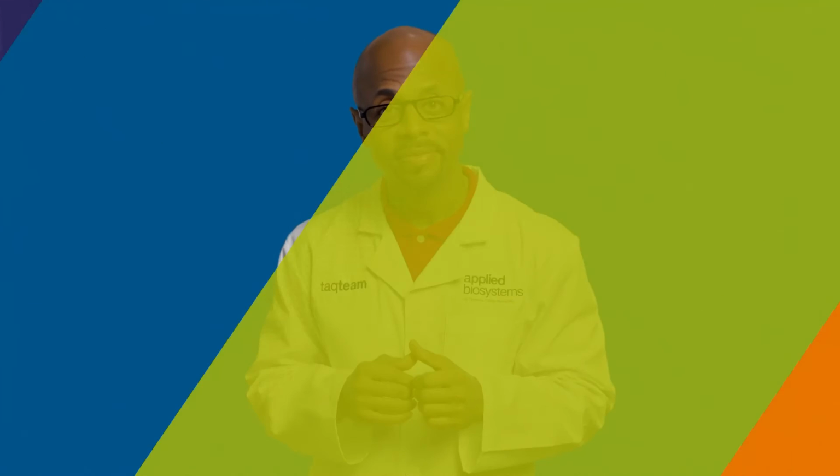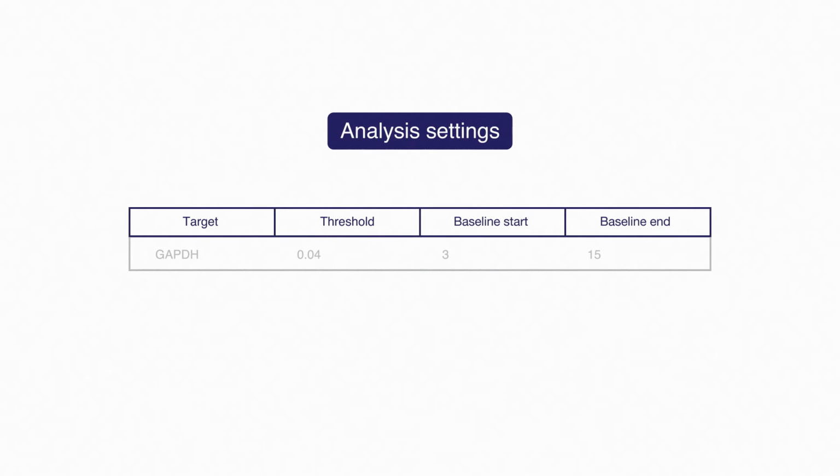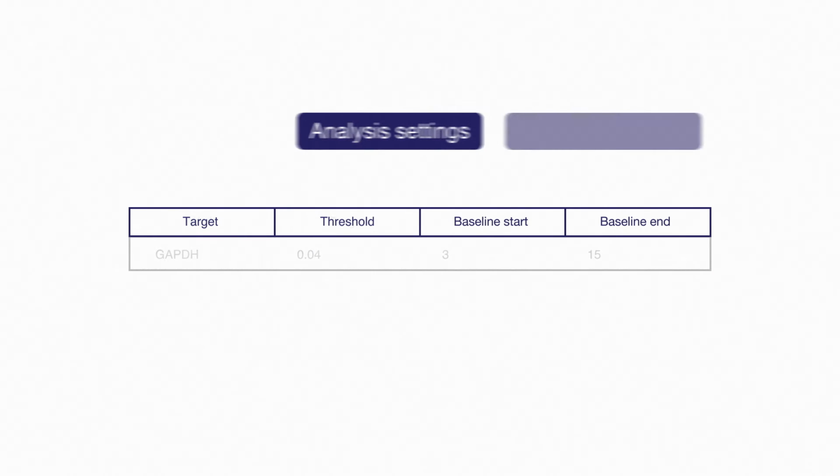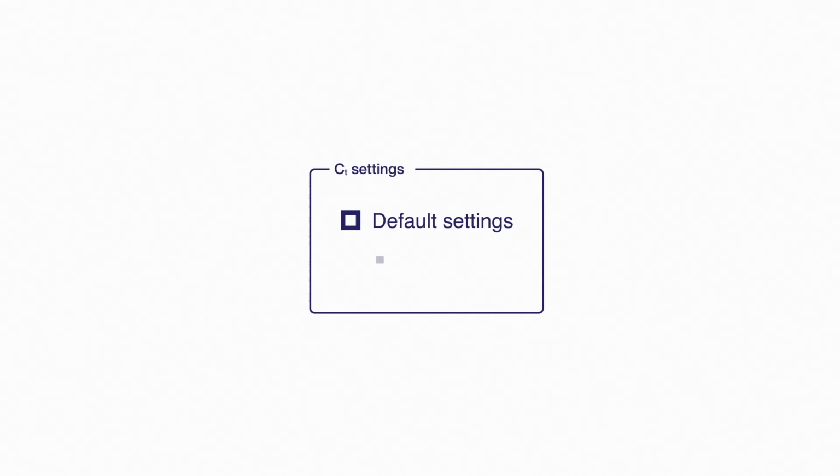But before you go, just note that there are two ways to set baselines in Applied Biosystems real-time PCR software, manually and in automatic mode. If you do it in the manual way, you set the baseline range under analysis settings. You either set it for a single assay, in which case all wells for that assay get the same subtraction, or you can go under advanced settings and set wells individually. Better yet, just use the default setting of auto baselining.